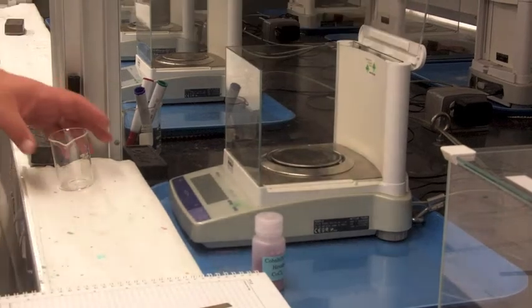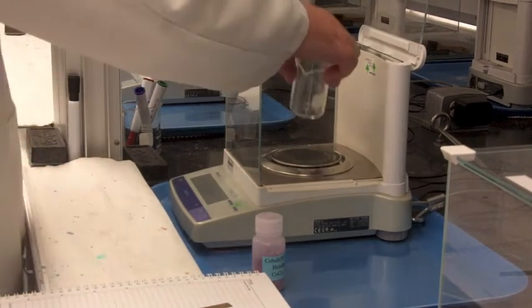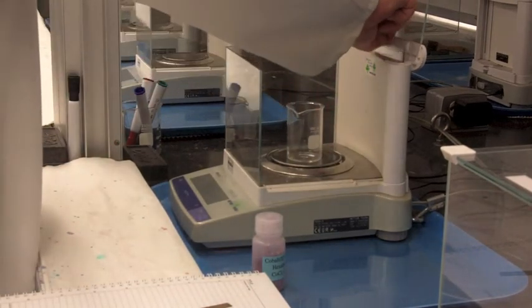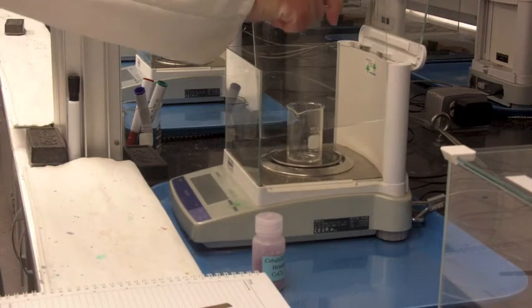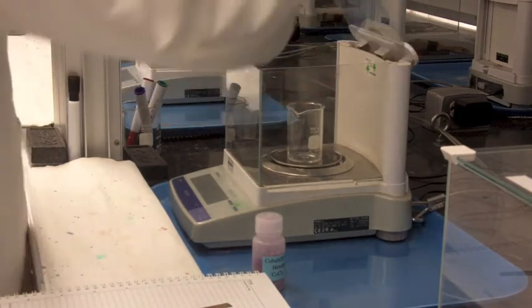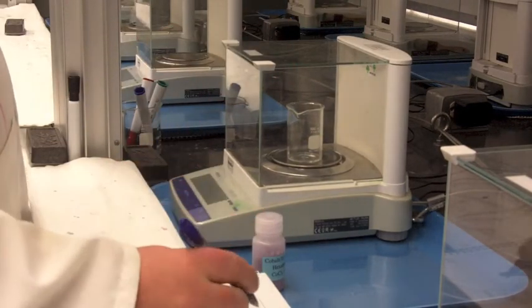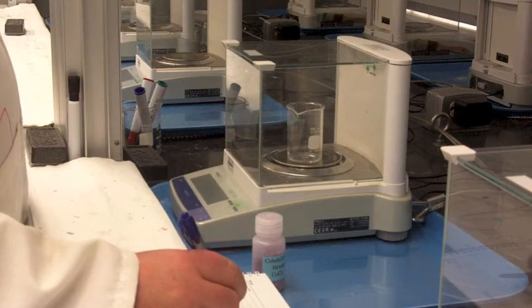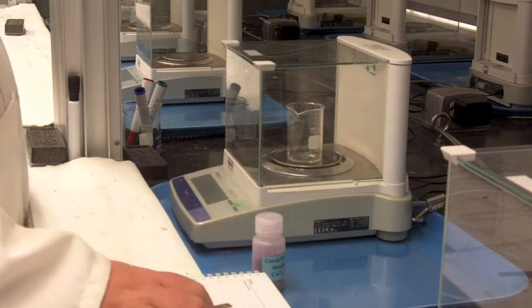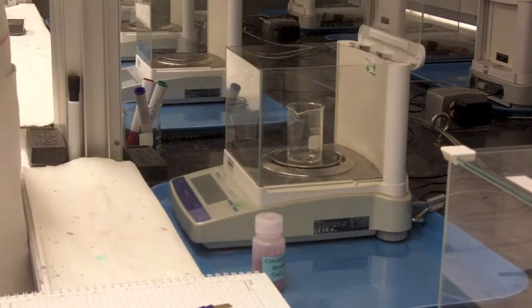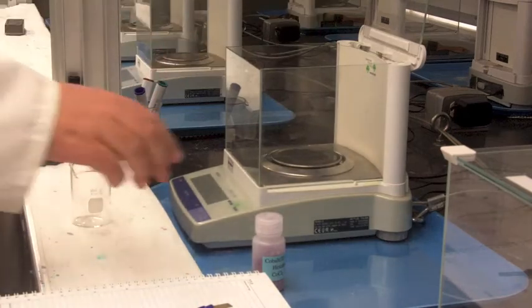Generally, if you're weighing something big, maybe you need to take it off, but we generally like to weigh things with all the lids down. There's a little bit of convection in this lab that does change your measurements. It's only going to change it significantly by a few milligrams, so if you're weighing out a large sample, convection doesn't matter that much, but if it's a small sample, it could have a huge effect.